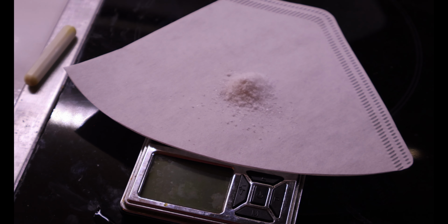So that makes my percentage yield on starting 2 grams about 19.2, so I'll say 19%, which is, well, abysmal. Yet it's something.